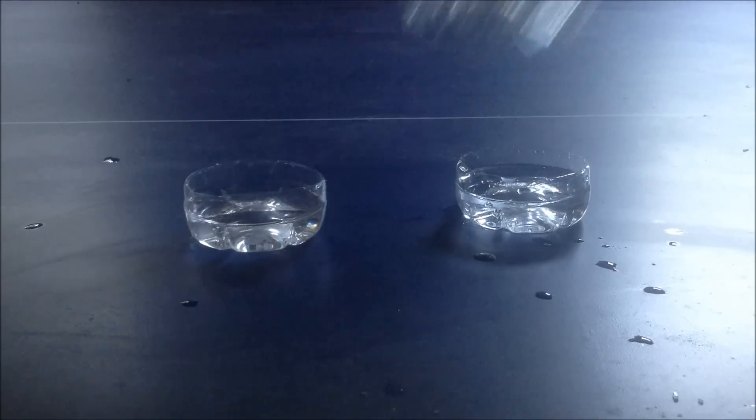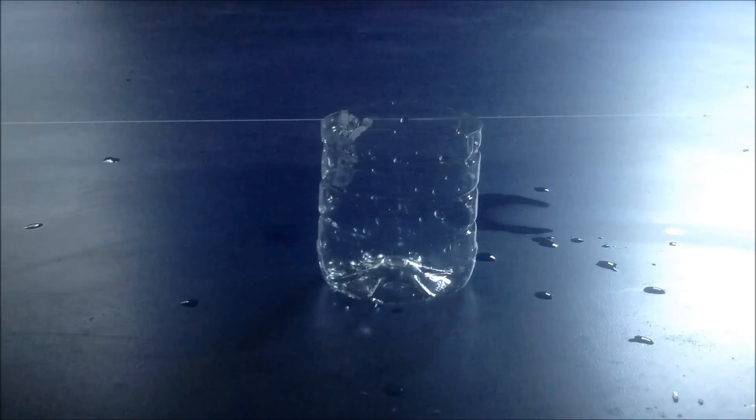So I'm going to have here a mixing chamber. Now I'm going to mix both together simultaneously because that's just cool and watch carefully.